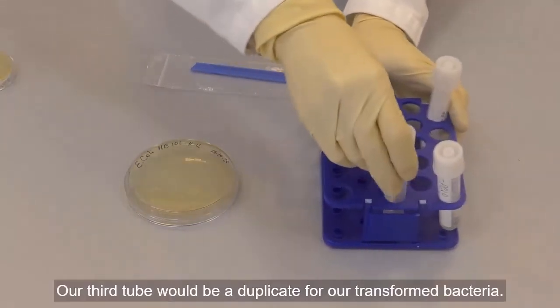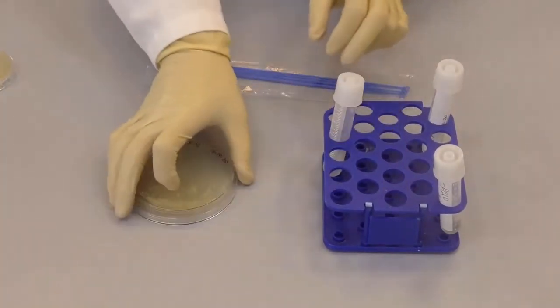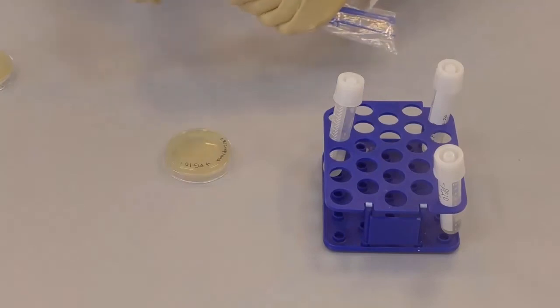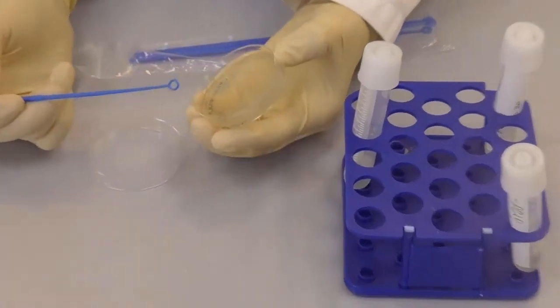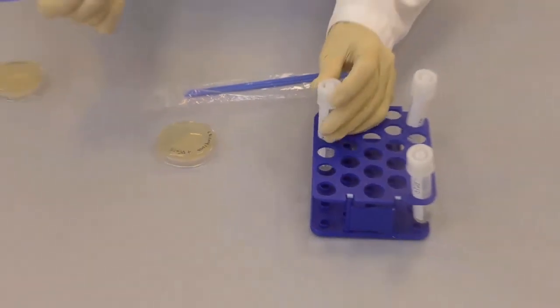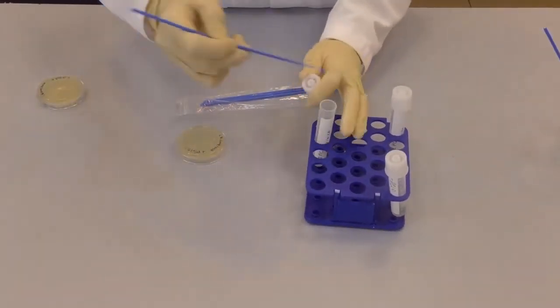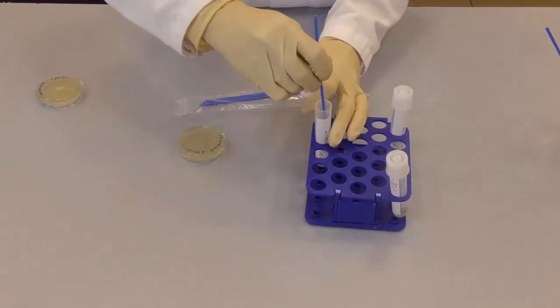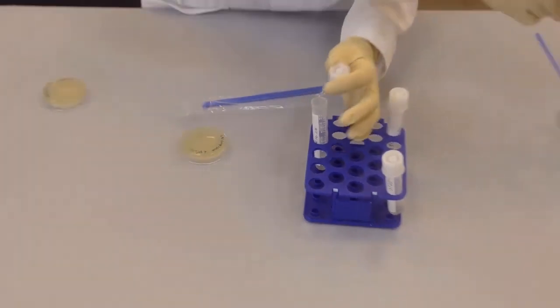The third tube is the duplicate for our transformed bacteria. Take the plate with the transformed bacteria growing on LB ampicillin arabinose, take one colony and transfer it to the tube. Immerse the loop inside the LB broth, mix it, and waste the loop.